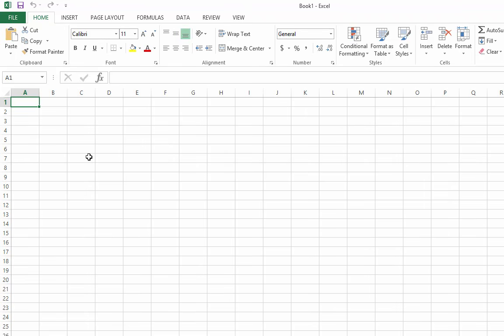Hello there, chemists! This video is designed to take you through some of the features of Microsoft Excel that will reduce time and frustration in your general chemistry laboratory course. These tips are inspired by some of the most popular mistakes and frustrations I saw as a TA for the students in the Chem 102L course.